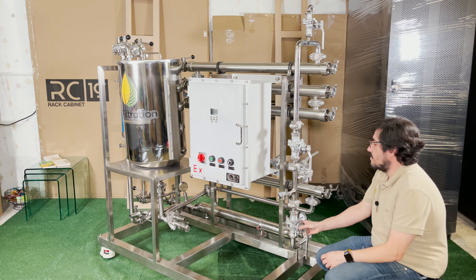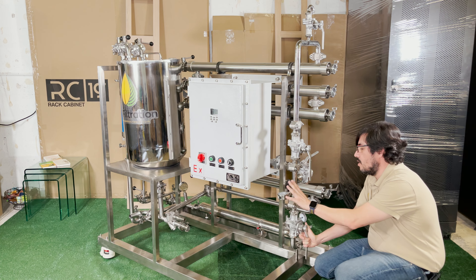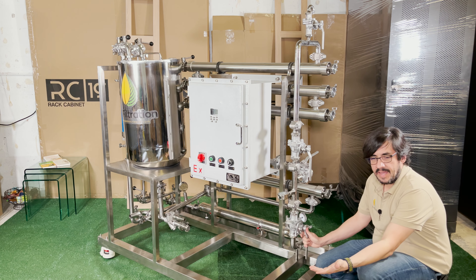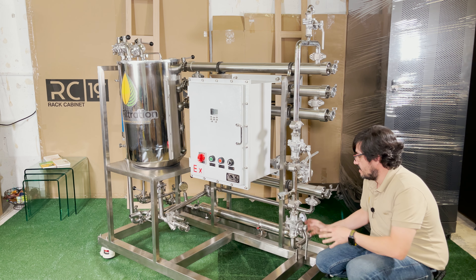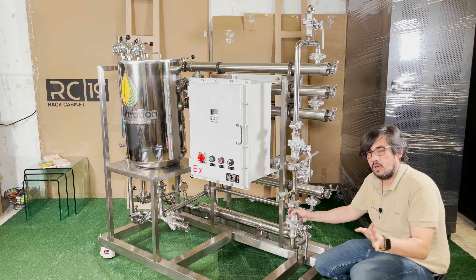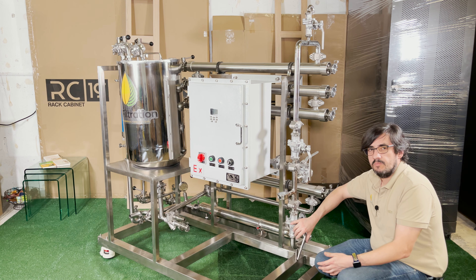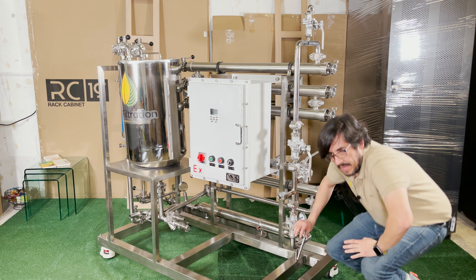Your pressure is going to be regulated with this valve right here — it's a simple function of monitoring your pressure with this valve. Always follow the manufacturer's recommendations and never exceed the maximum operating pressure. We're going to start with this valve fully open, then gradually close it gently while operating. The pressure will increase as we close the valve until we reach our set point pressure.